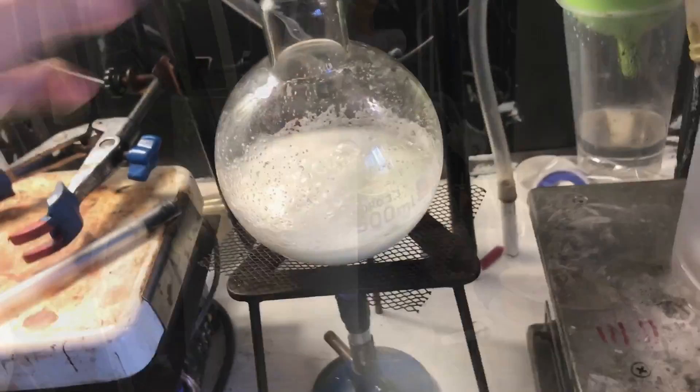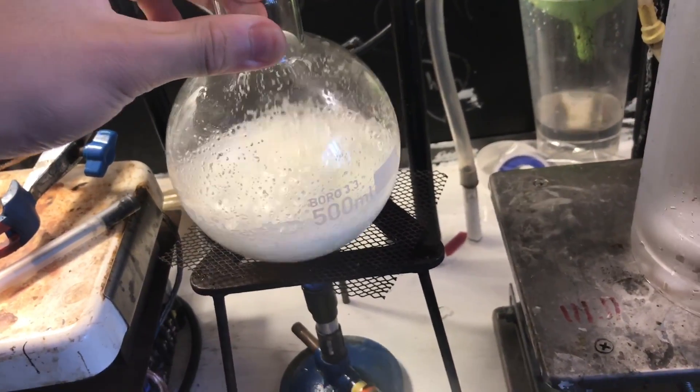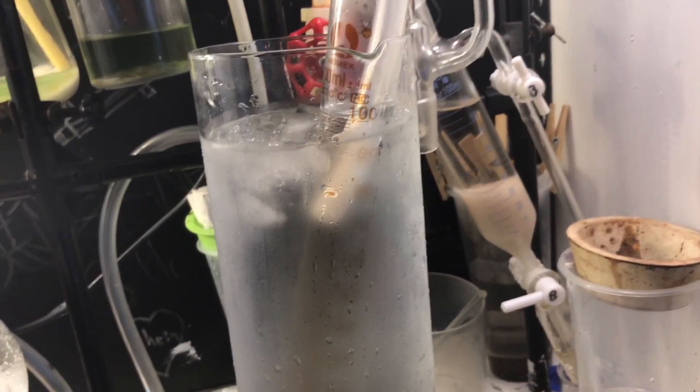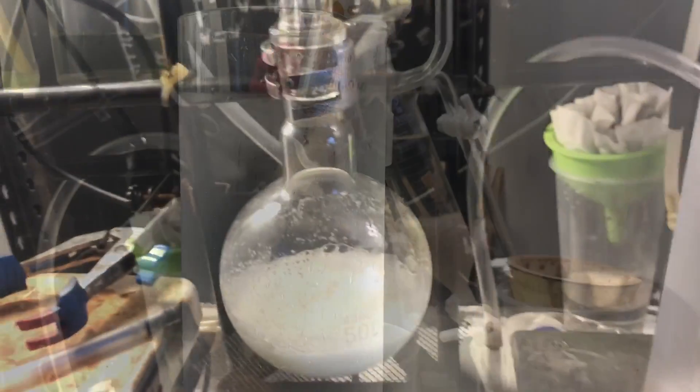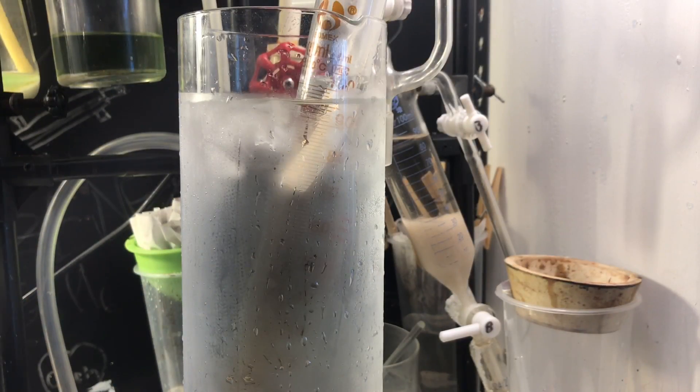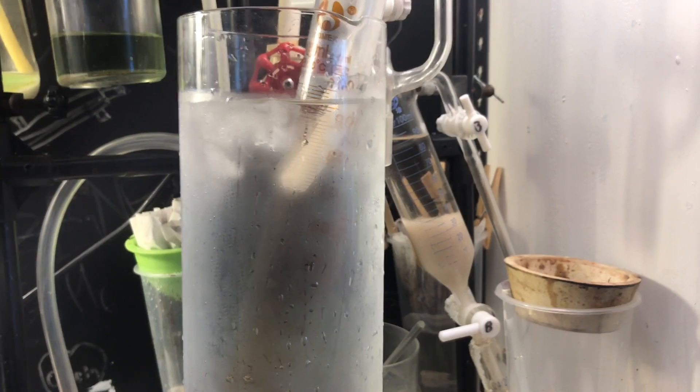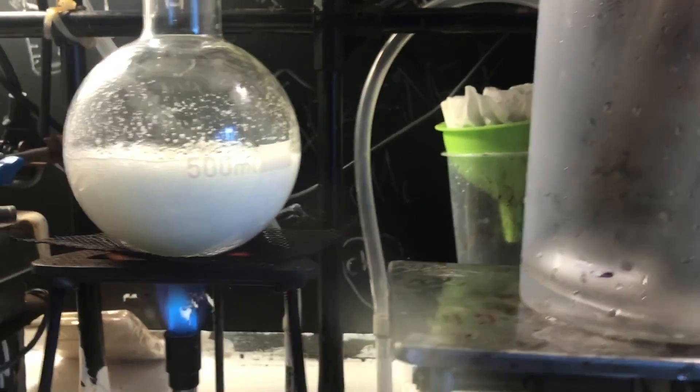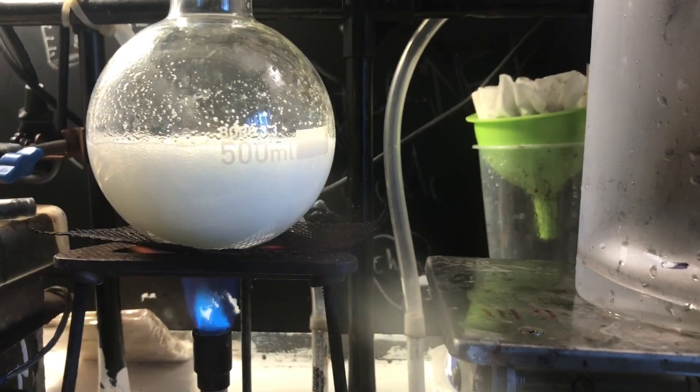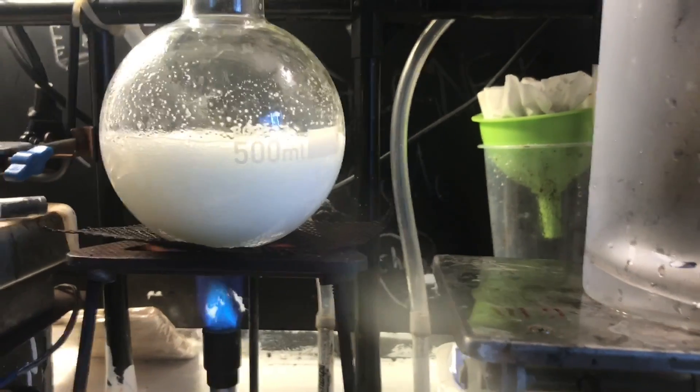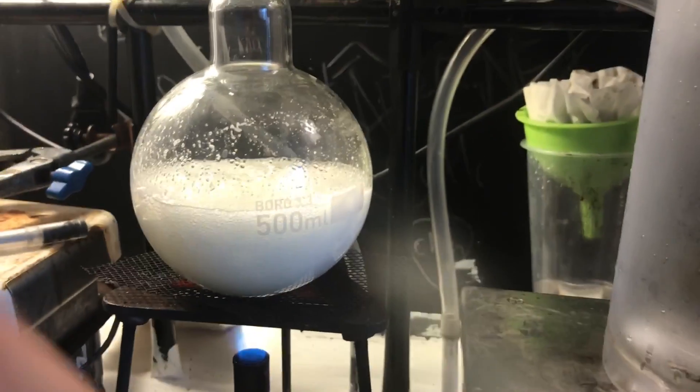As you can see, it bubbles away making HCl gas. This is a very common time where it just foams up and explodes your apparatus, so be careful when heating it. We're getting some nice gas generation, and it's not foaming up too much. However, when it starts to run dry, that's when the foam really is an issue.